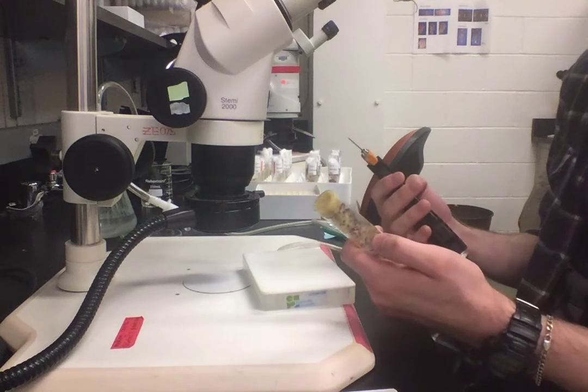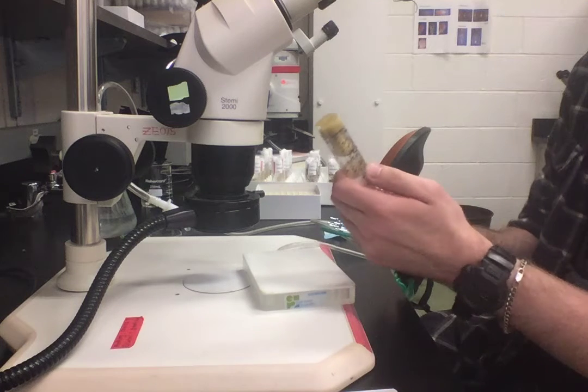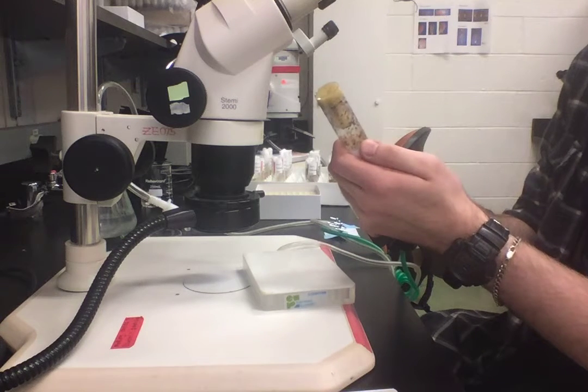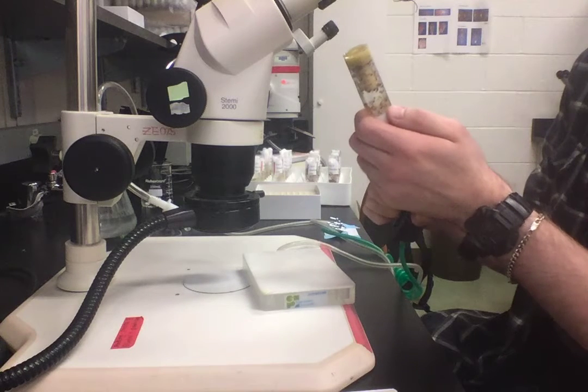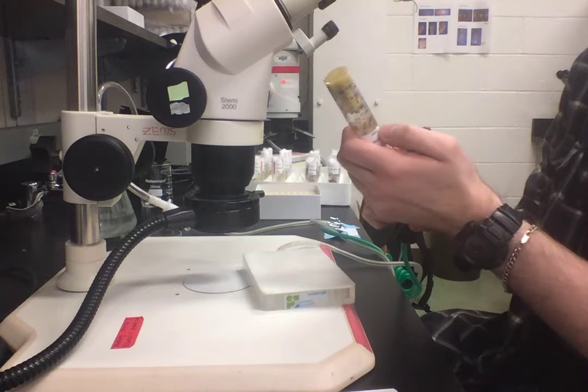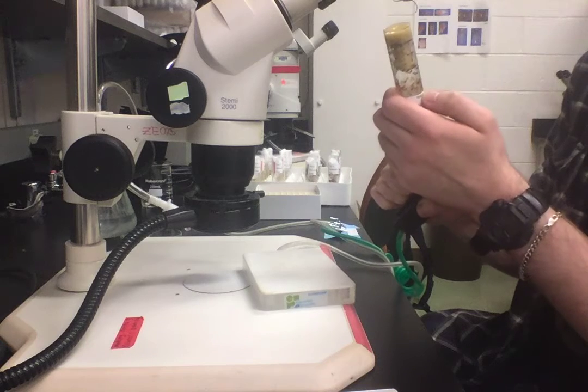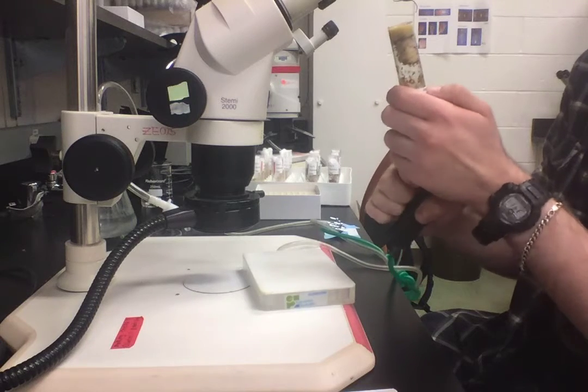Whenever you're taking flies out of the vial, you're going to gas them carefully. If your vials are old, like mine, they might get stuck to the cotton ball because the cotton ball gets wet and sticky over time, so you just want to be aware of that.